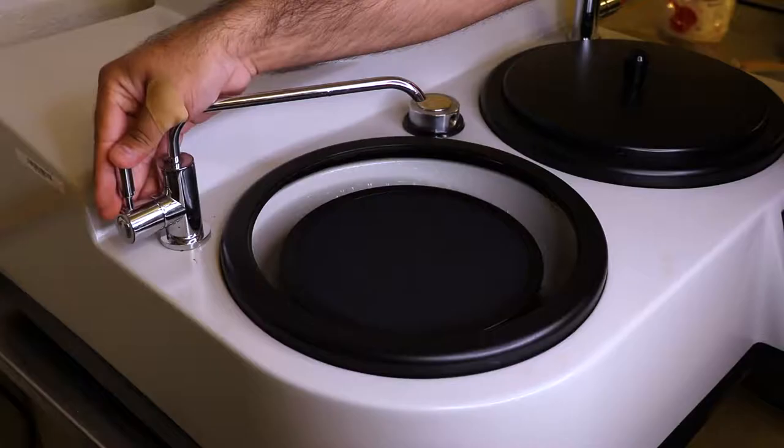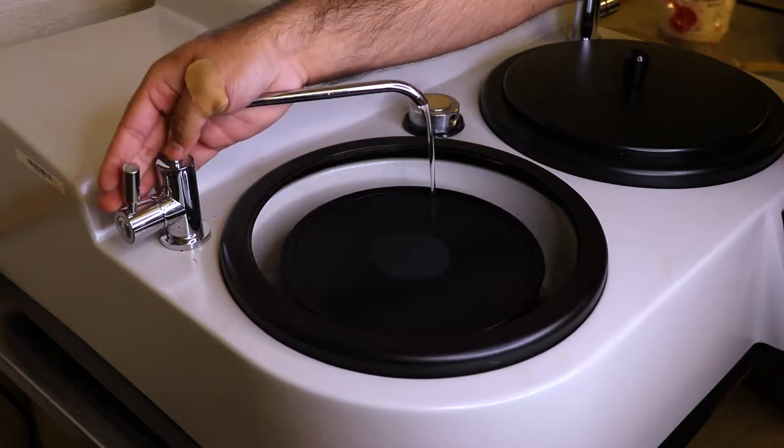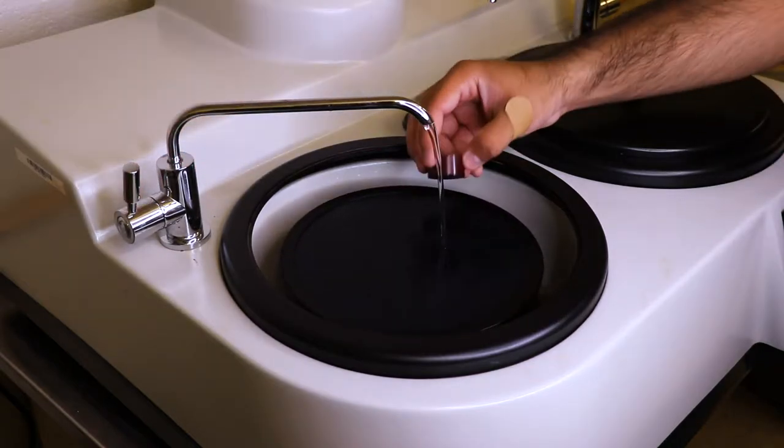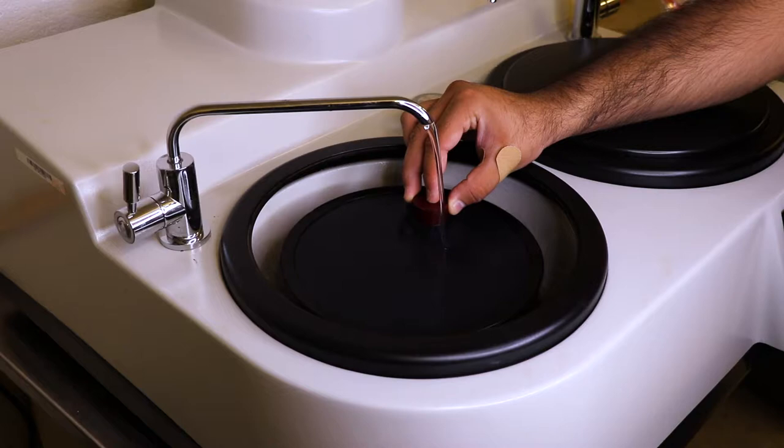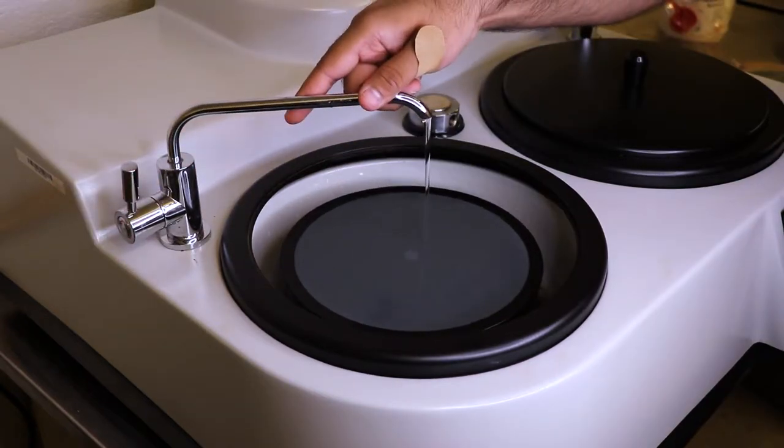You want to take your sample and just touch the sandpaper, and don't apply too much pressure. You want to basically hold it in place so that it can be ground evenly.